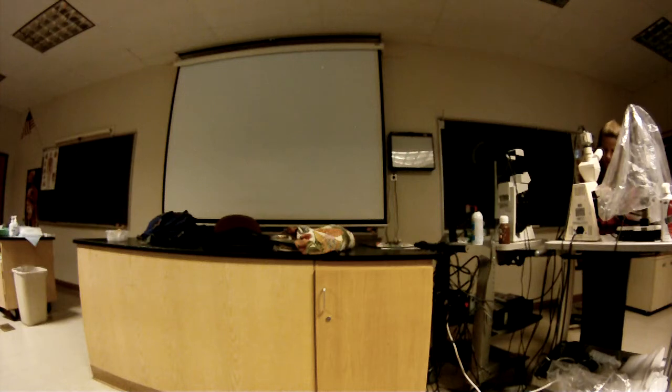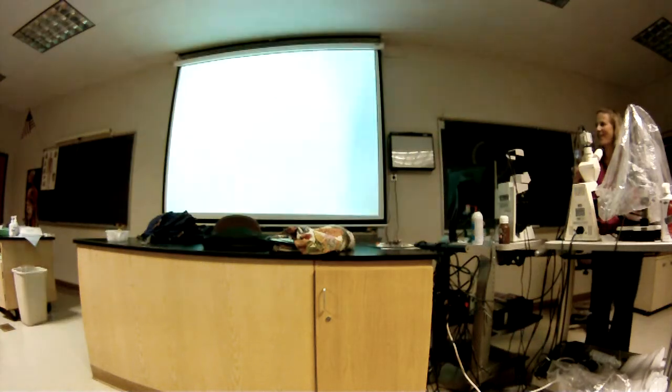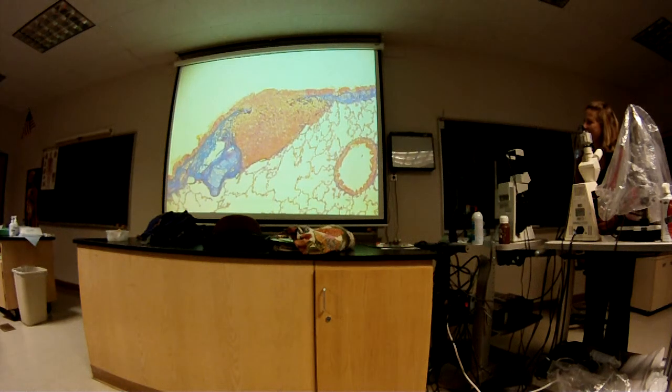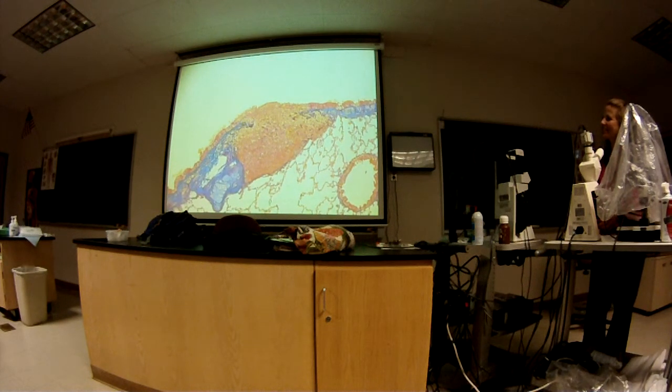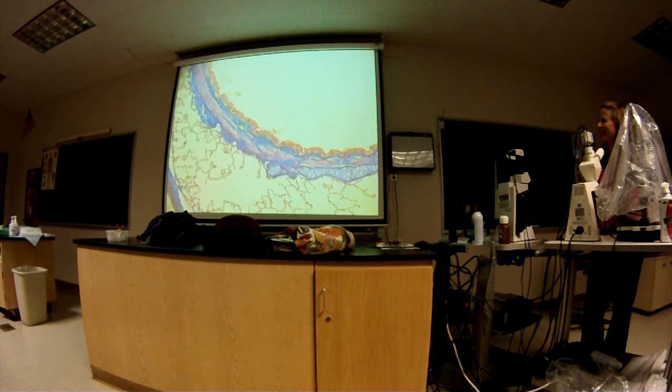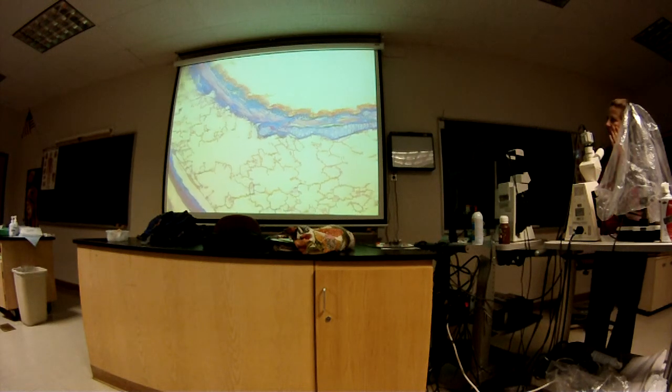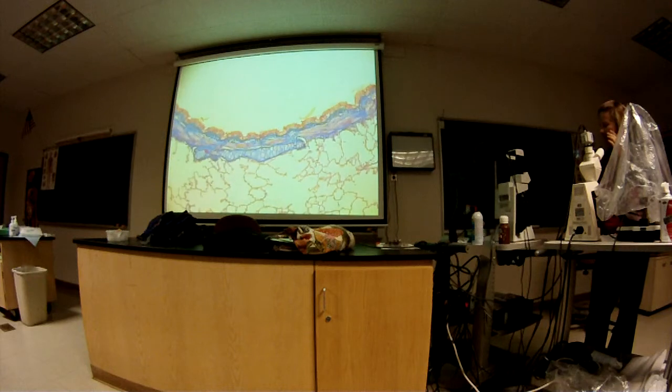Oh, I think I see it. Okay. I was expecting it to be a little more obvious. I fall into that trap, huh? Expect it to jump out at you. The coloring on the slide's a little bit different too, so it's good to see a slide that has different dyes used, because you get used to what the slide colors look like, what color each tissue has, and then it can be misleading. Sorry, the focus is not perfect on this, but enough.